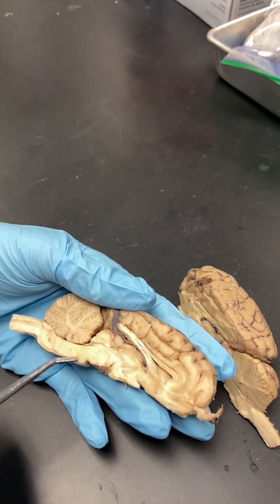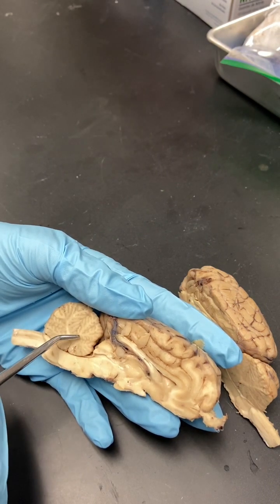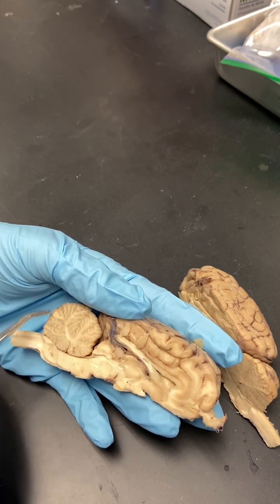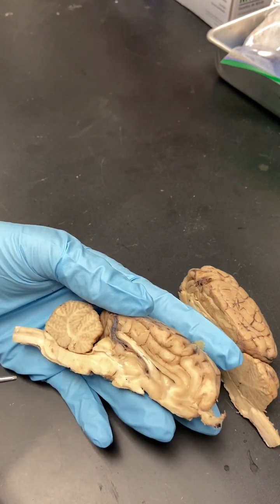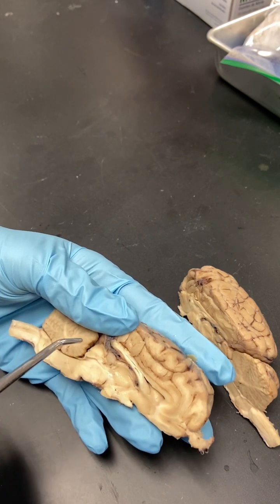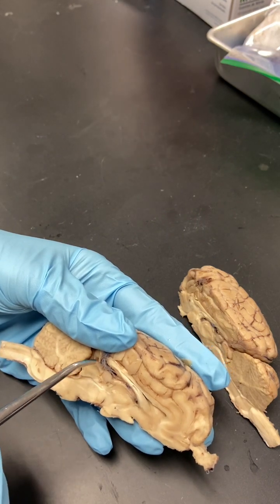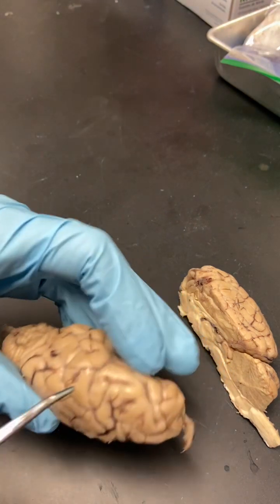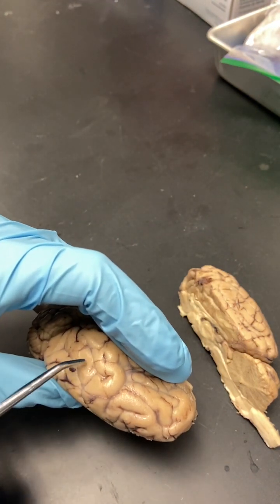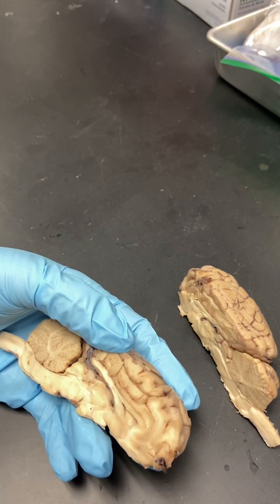So in here you have the cerebellum, you see the arbor vitae, and these are storing the memories of our muscle, for muscle memory. The cerebellum in general is for motor movement and function. Now, if you do cut in past the pineal gland and past the colliculi in the temporal lobe, if you cut into the temporal lobe, you can expose the amygdala. And so I'll try and show a picture of that if someone's able to expose that really well.